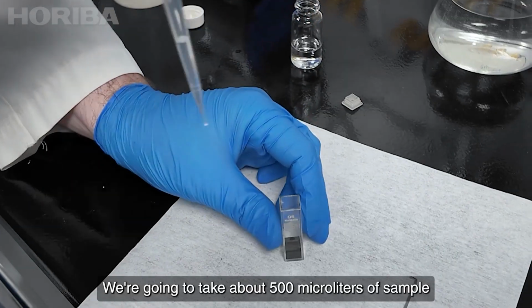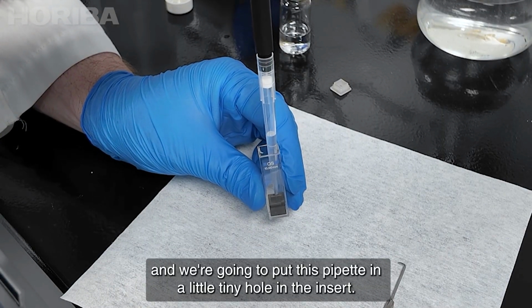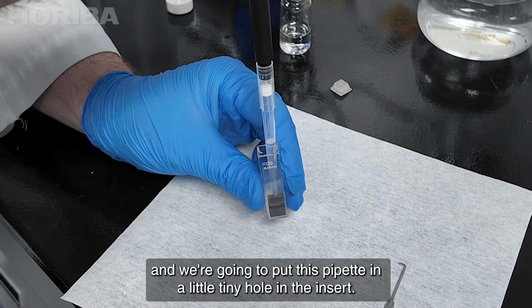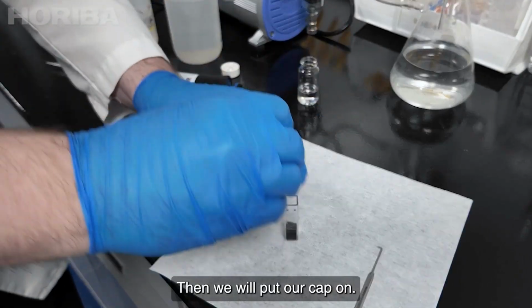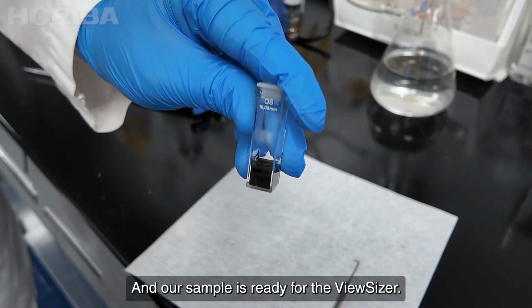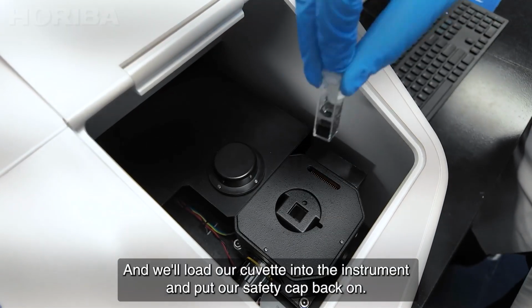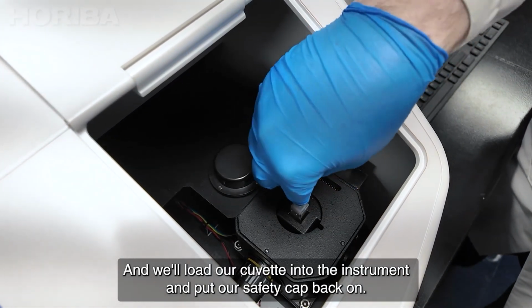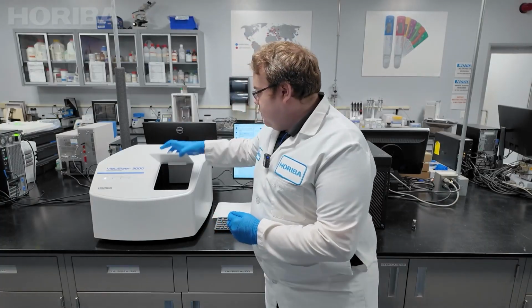We're going to take about 500 microliters of sample, and we're going to put this pipette in a little tiny hole in the insert, and we'll slowly add our sample, and then we will put our cap on, and our sample is ready for the ViewSizer. What we're going to do now is take out the safety cap, and then we'll load our cuvette into the instrument, and we'll put our safety cap back on.